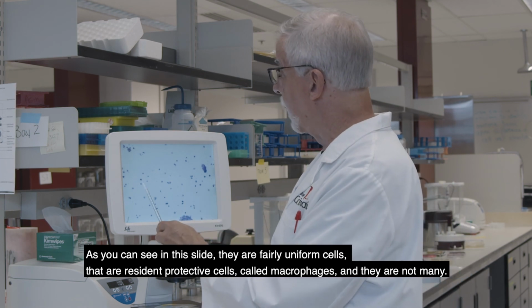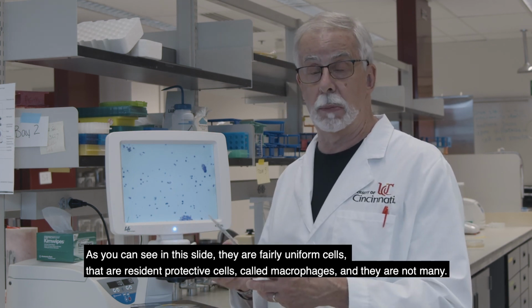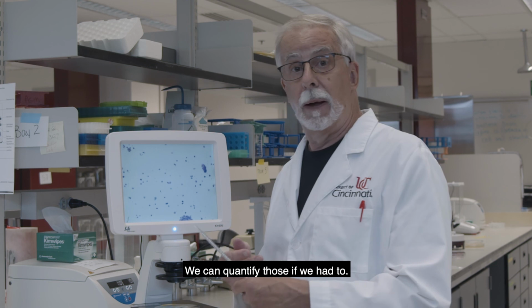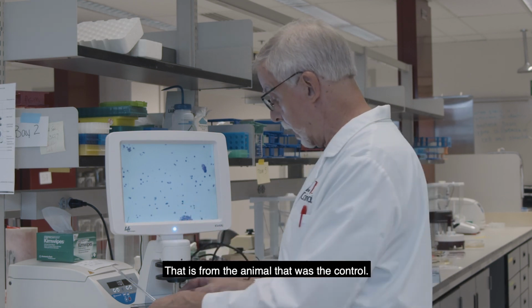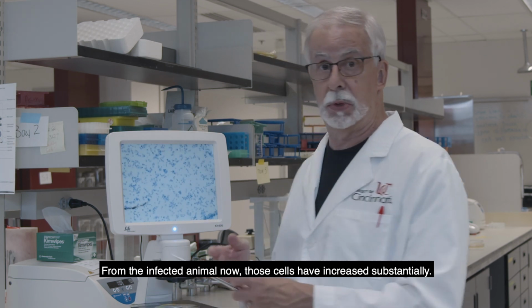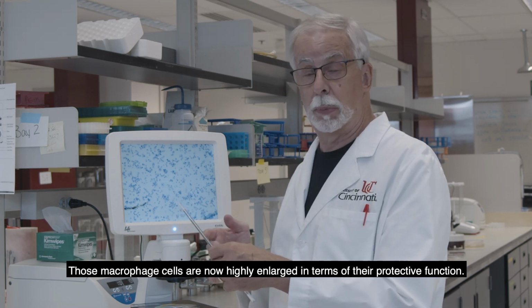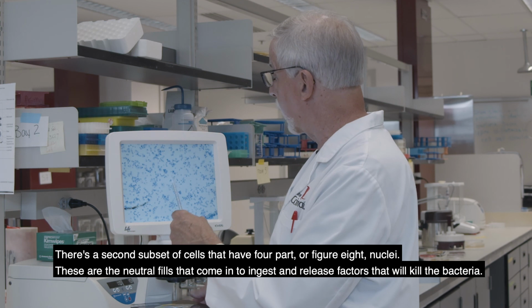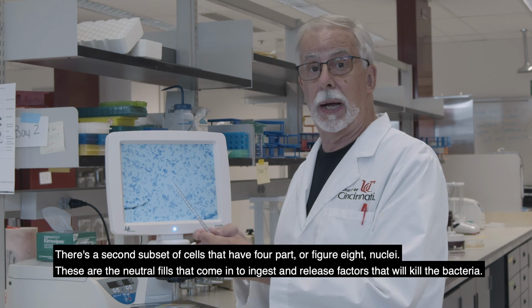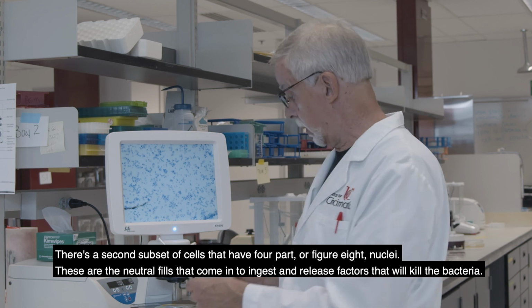As you can see in this slide, they're fairly uniform cells that are resident protective cells called macrophages, and there are not many. We could quantify those if we had to. That's from the animal that was the control. From the infected animal now, those cells are increased substantially. Those macrophage cells are now highly enlarged in terms of their protective function. And there's a second subset of cells that have 4-part or figure 8 nuclei in them. And these are the neutrophils that come in to ingest and release factors that will kill the bacteria.